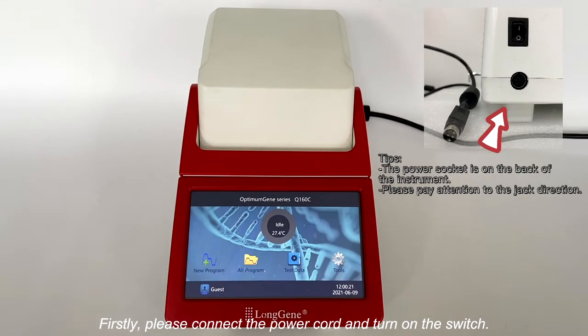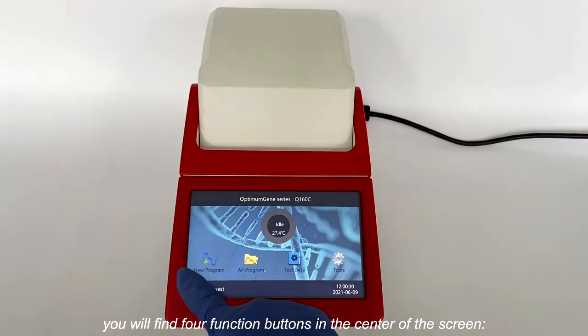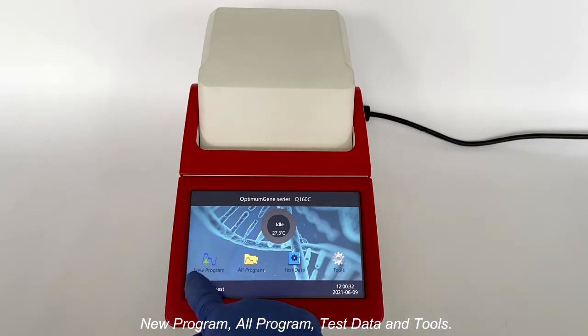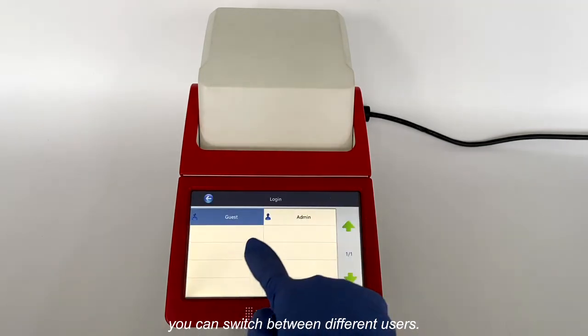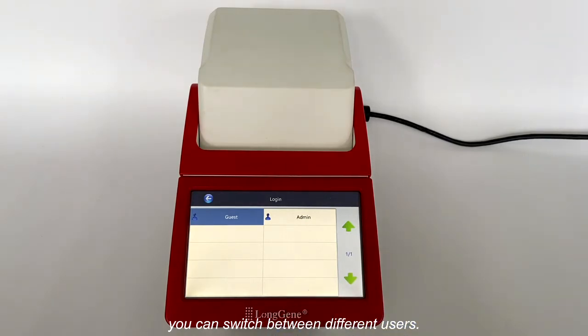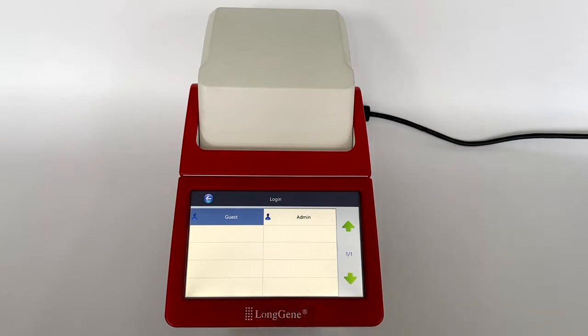Firstly, please connect the power cord and turn on the switch. After turning on the instrument, you will find 4 function buttons in the center of the screen: New Program, All Programs, Test Data, and Tools. In the bottom left corner is the username. You can switch between different users. Select the username to view experimental data. The password for admin is admin.